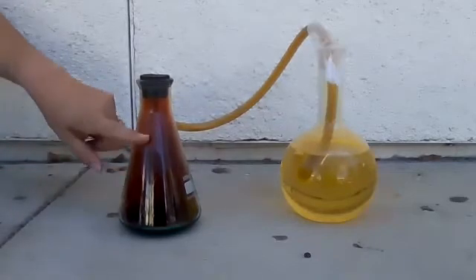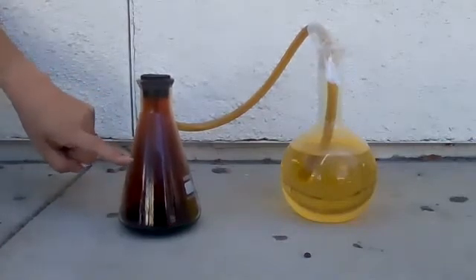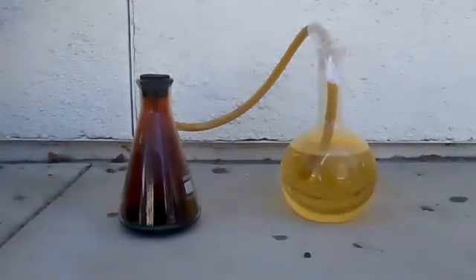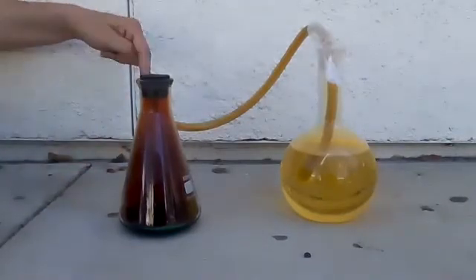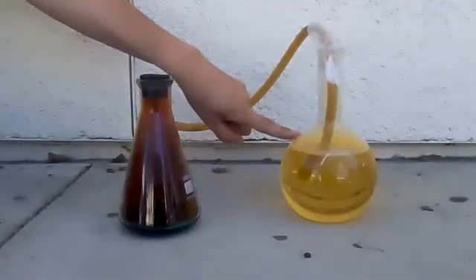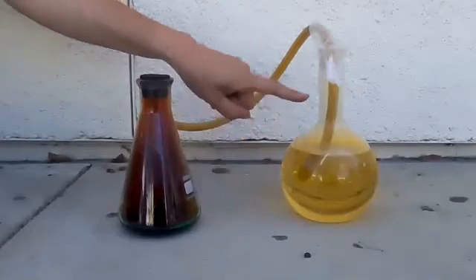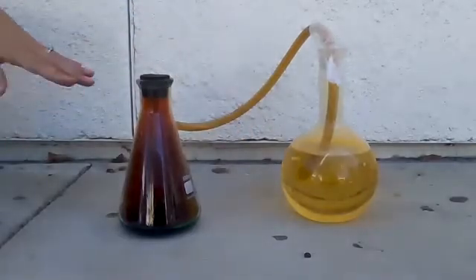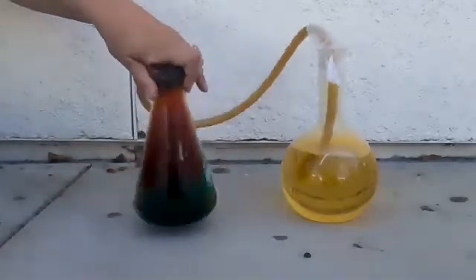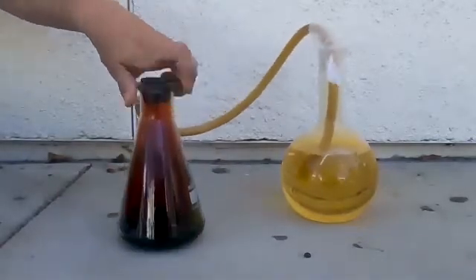Could you imagine breathing this in? Not very good. But this is what pretty much makes our air brown — this, but diffuse. So we've got the brown gas NO2 coming in here, mixing with the water to make HNO3. It turned from red to yellow to show it's acidic. The pennies are still reacting.